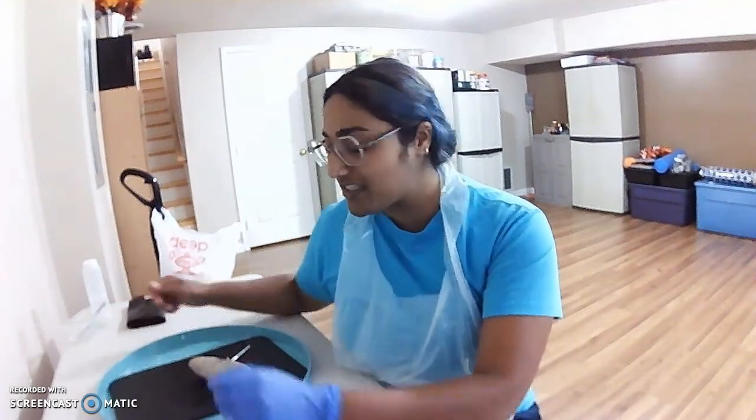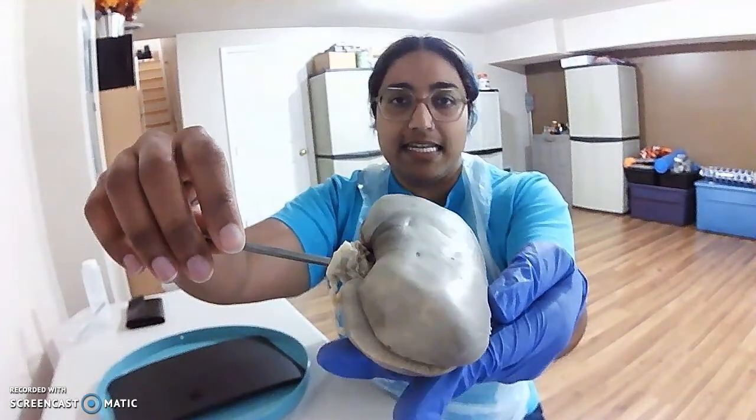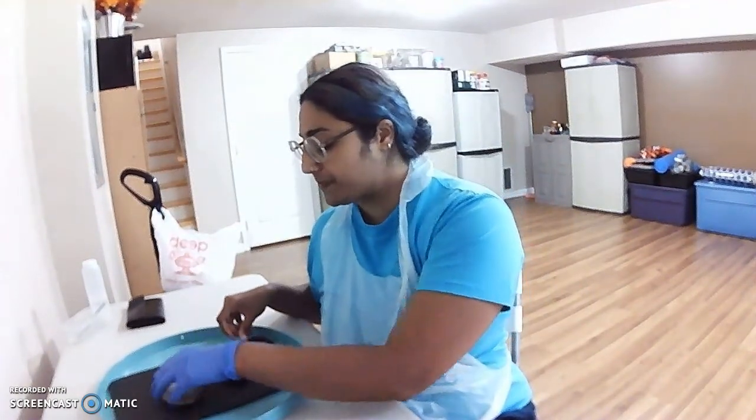Hi, and welcome back. Today I'll be conducting my final major organ dissection for anatomy and going over the urinary system, which is the organ system that filters most of the metabolic waste from our body. The major filtration organs are the kidneys. This is a porcine kidney that I've dissected longitudinally to view the internal components.